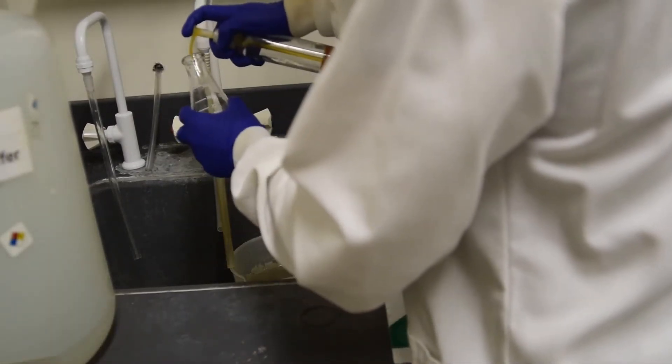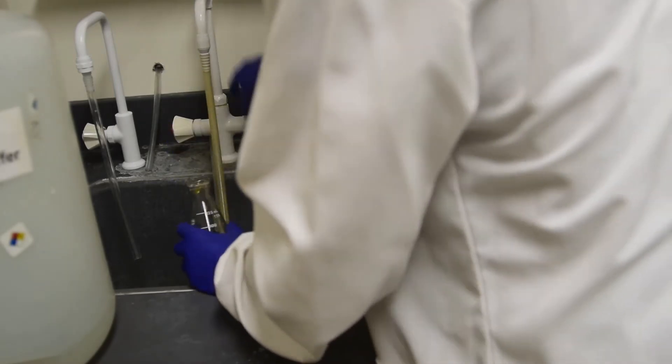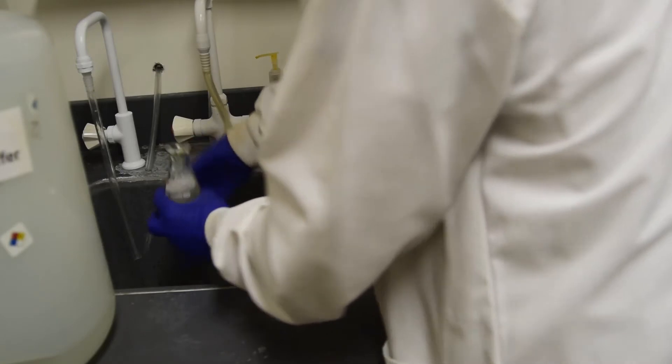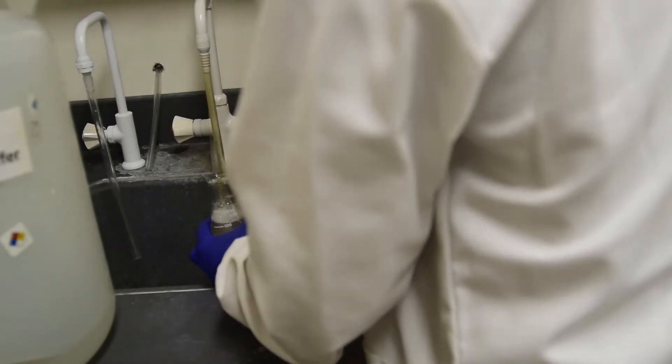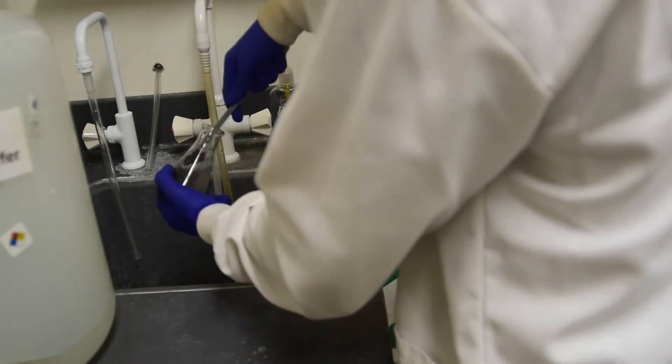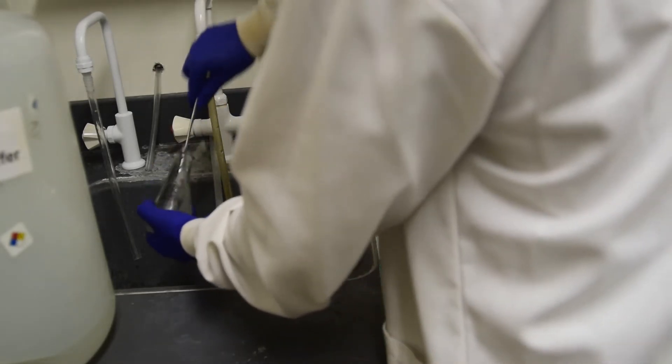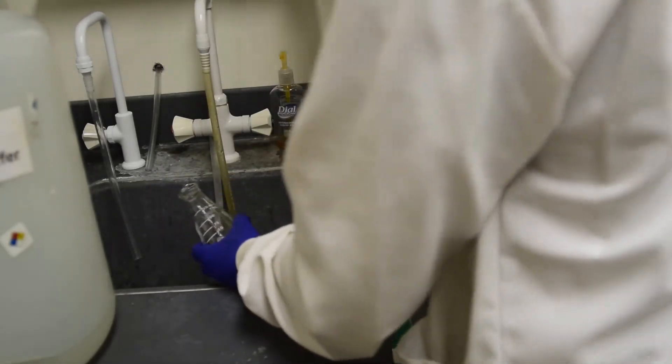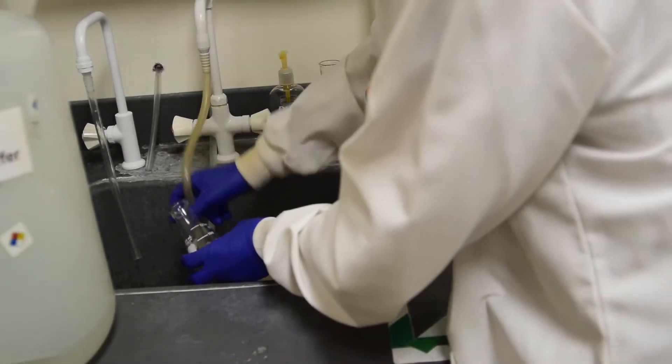Immediately clean the flask by adding soap and water and scrubbing thoroughly with the brush. Rinse with tap then distilled water.